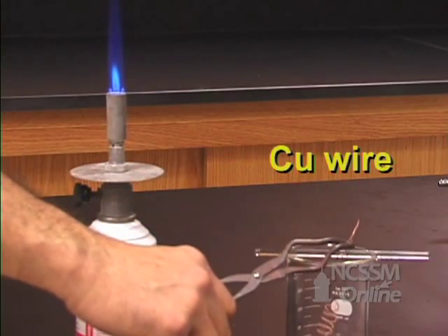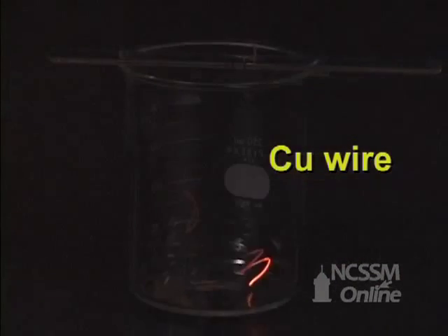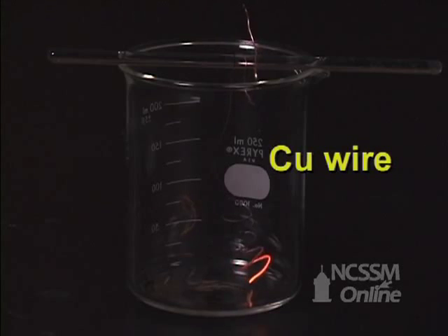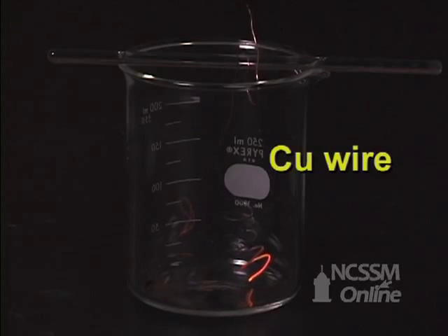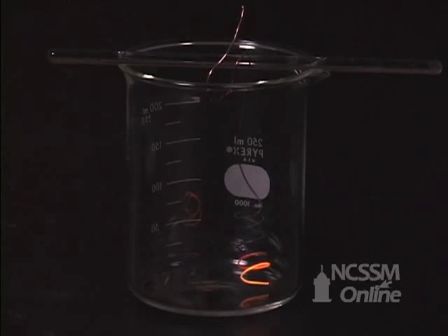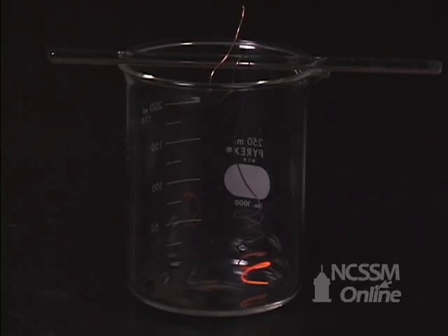The copper catalyzes the oxidation of the acetone. The reaction is exothermic, which causes the catalyst to glow red hot.